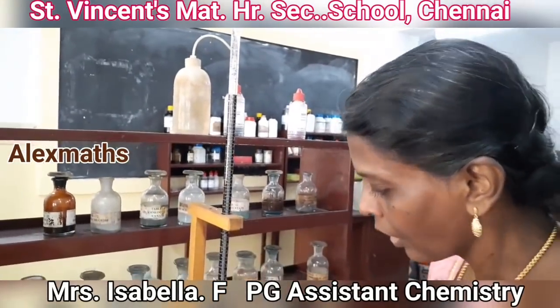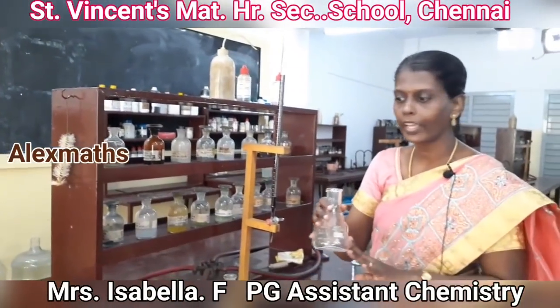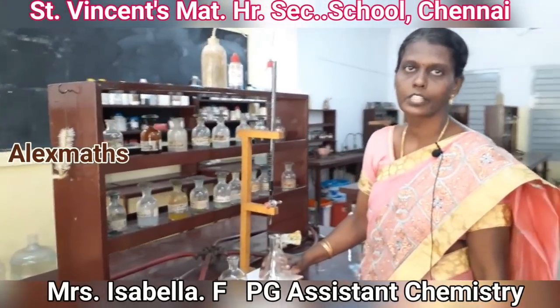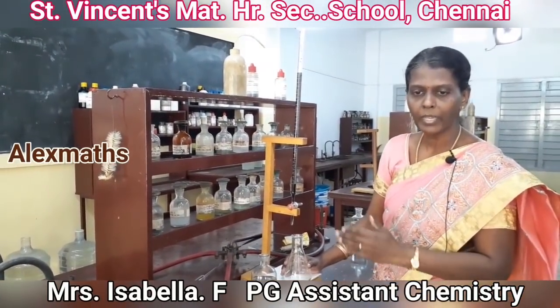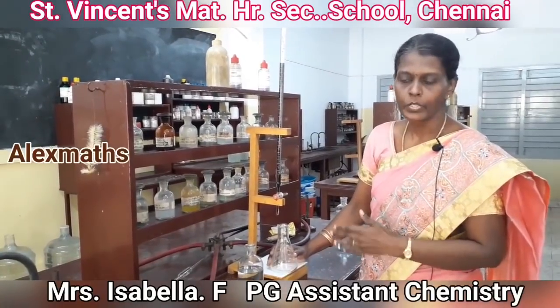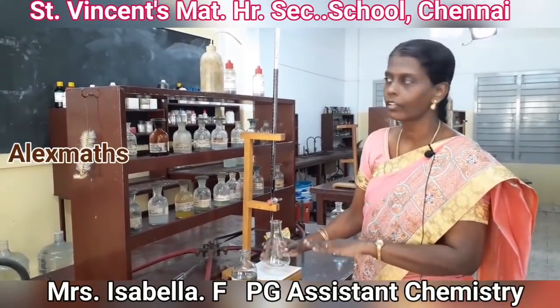After which the contents of the conical flask, they are thrown out into the sink. Wash the conical flask thoroughly. Repeat the same experiment using the same solutions. We should get concordant values. Now concordant values means the immediate 2 trials, trial 1 and trial 2, the values should be the same. So that is what we call as concordant values. So note down the concordant values in the tabular column.